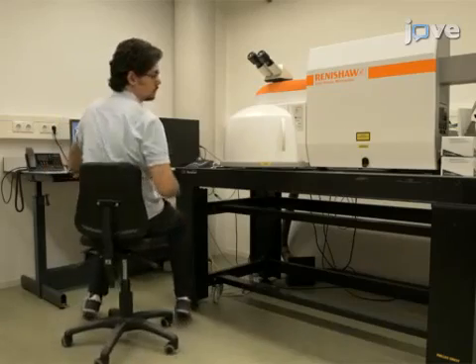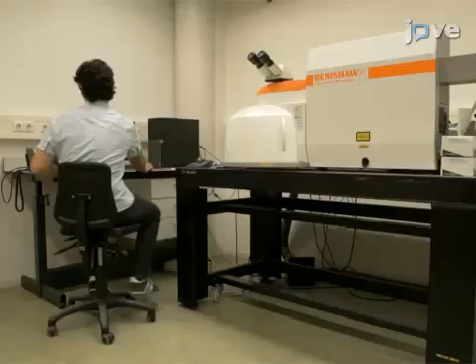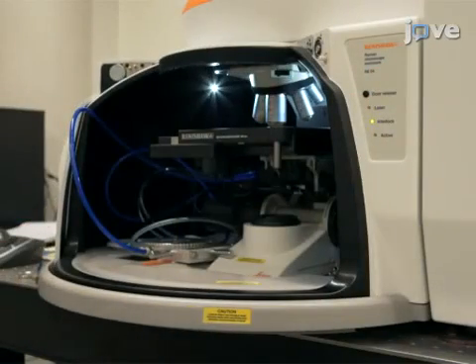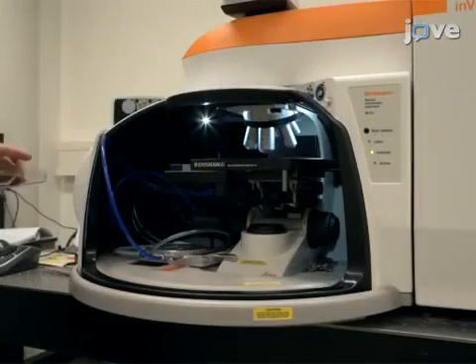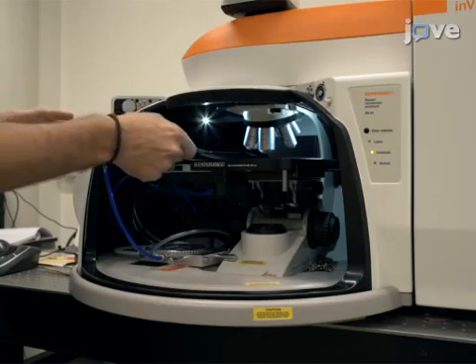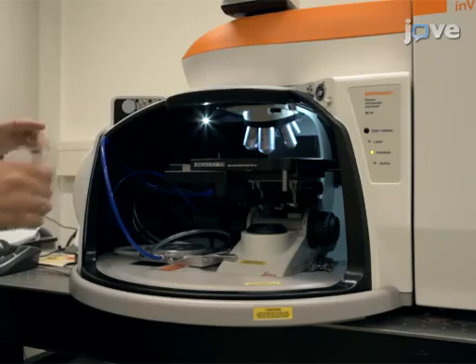Observe that the lights of the laser and the active are turned off. Then, press Door Release and open the door of the measurement chamber. Then, measure a bulk reference of the nanomaterial by repeating this process using a reference sample. From the peak position of the bulk material, estimate the relative shift.